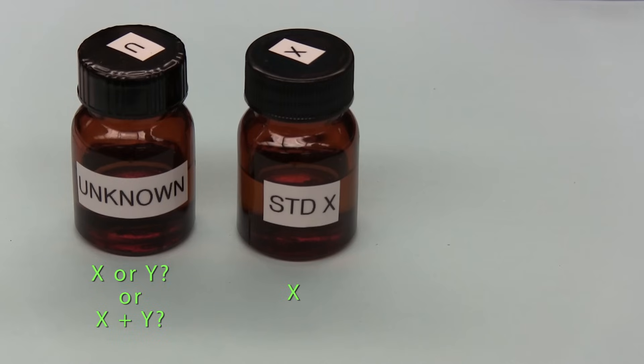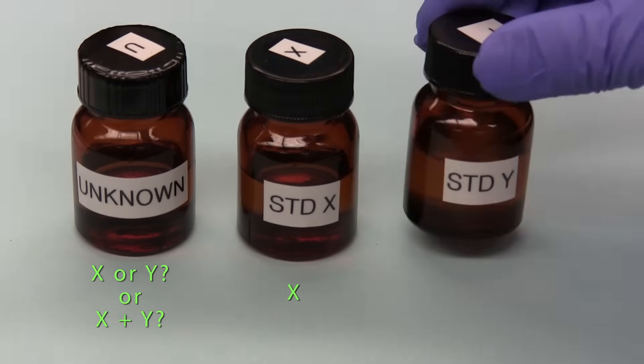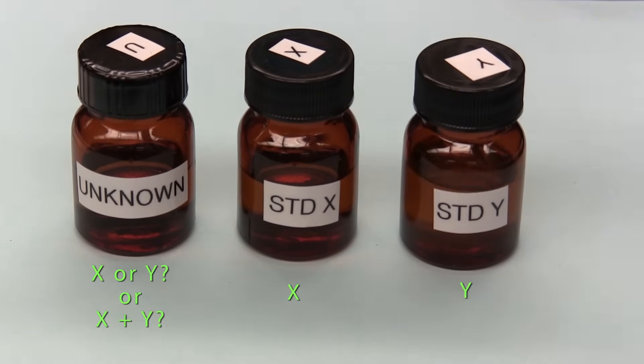In this bottle, we have an authentic sample of compound Y, a sample which we know beyond any doubt is compound Y, so we call it standard Y. And this is our second reference.